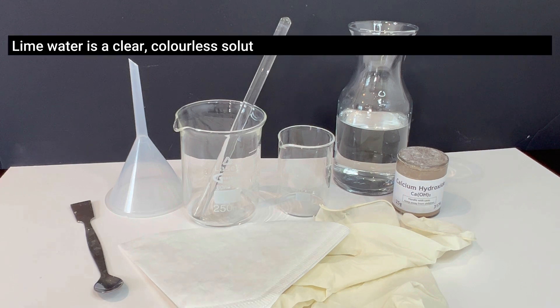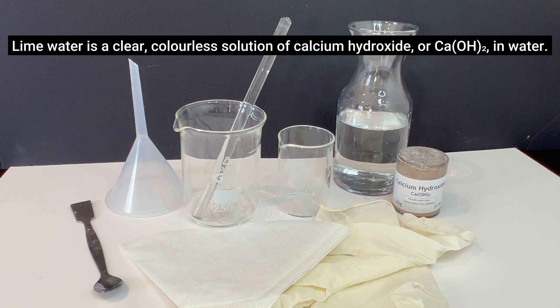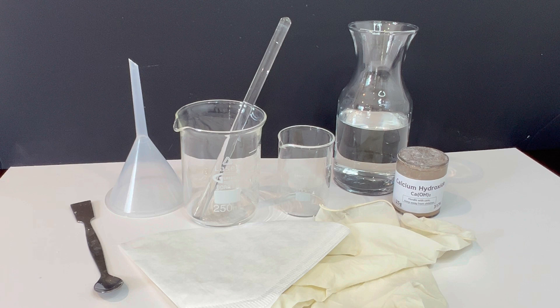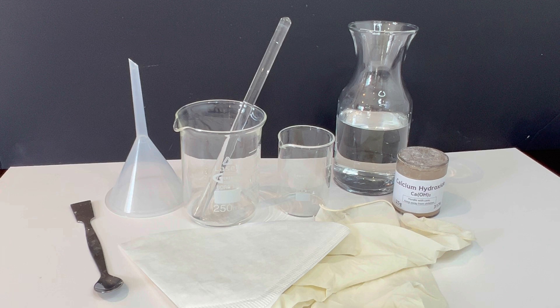Lime water is a clear colorless solution of calcium hydroxide in water. When carbon dioxide is bubbled through it, a white precipitate of calcium carbonate forms. This is a key test for carbon dioxide in chemical reactions or respiration experiments.